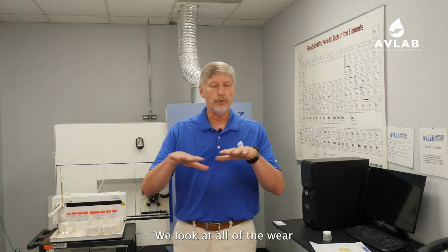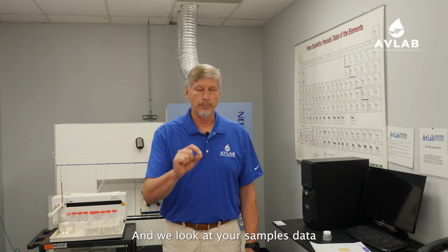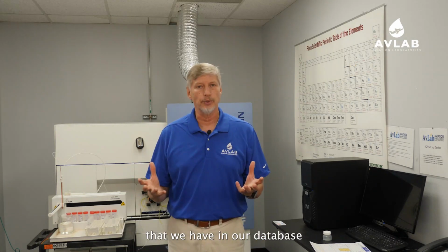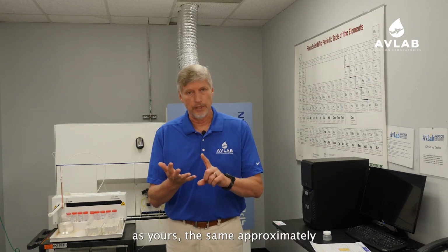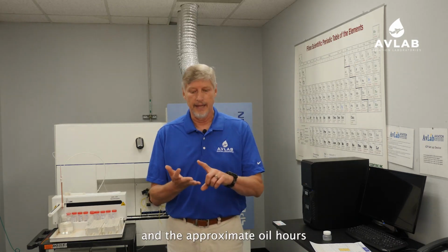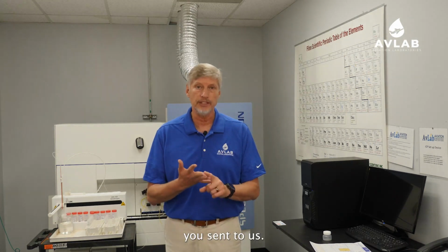We look at all of the wear metals, 12 or 15 wear metals that we're actually looking at, and we look at your sample's data versus all of the samples that we have in our database that are the same engine type as yours, approximately the same number of engine hours as what's on your engine, and the approximate oil hours that are the same as the oil sample you sent to us.